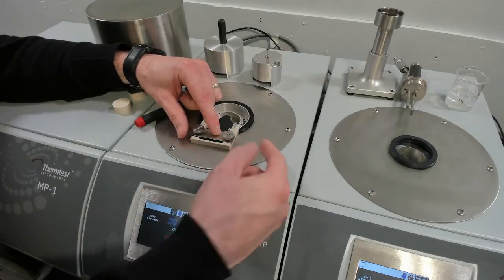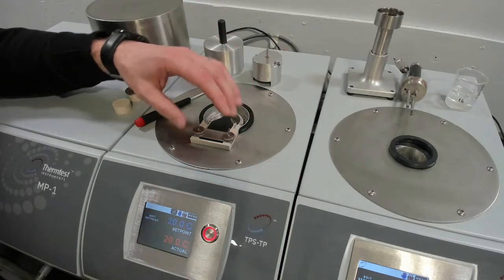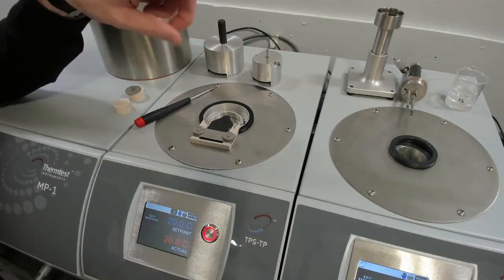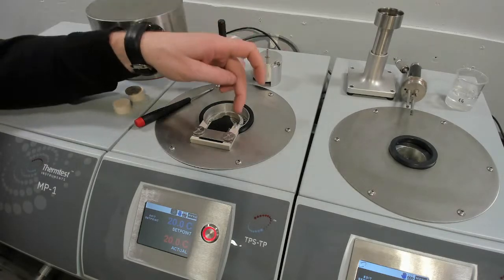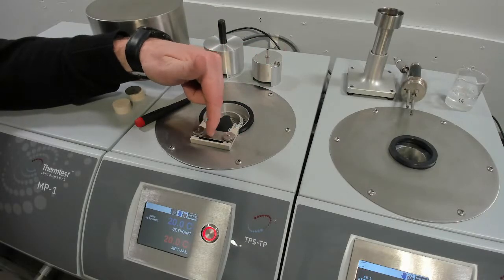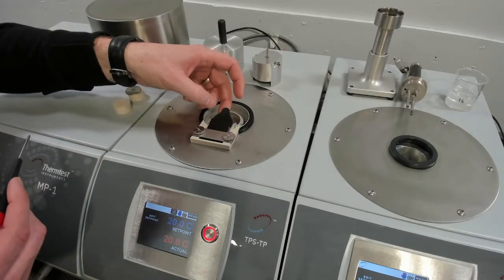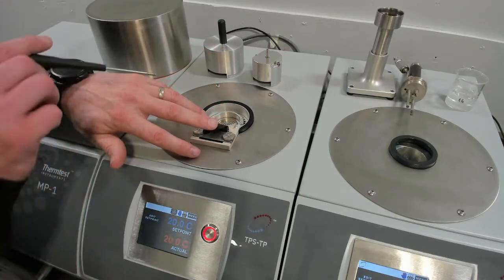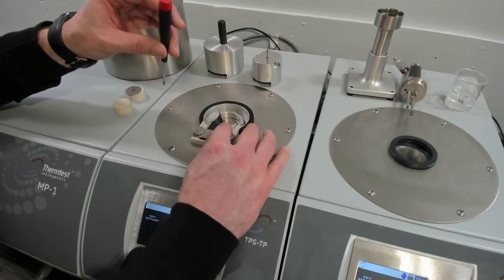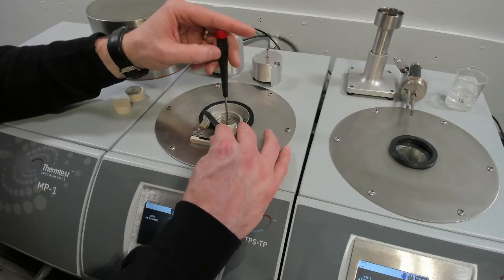And then when you want to secure your sensor, you just spin these down until they stop just off of mild turning, and then just a quarter turn each, and then you know your sensor's secure. There's a step in the software that we say test the electrical resistance, and that confirms that the sensor is electrically connected before any measurements are made. So the floor of the temperature platform goes up and down. So I'll sort of gently move the sensor out of the way so you can sort of see what that looks like. And that accounts for different height of your sample.